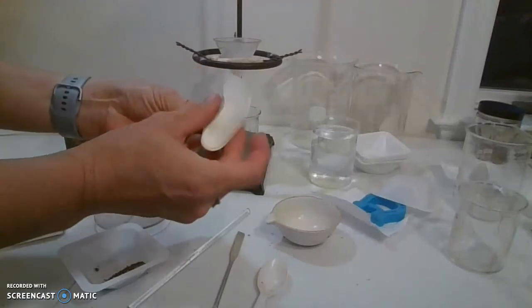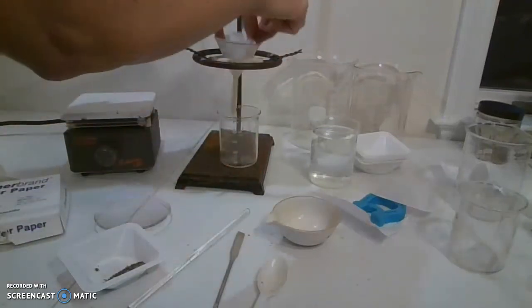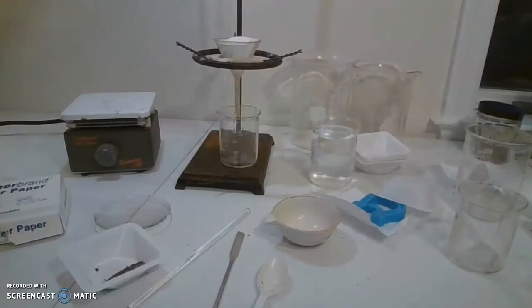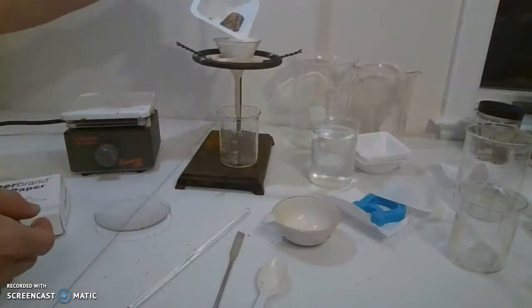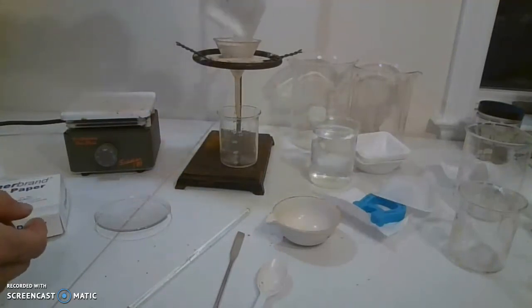finger between the first and the third so it makes a little paper cup, and it sits in there nicely. Then I'm going to take my whole mixture and put it into the funnel.